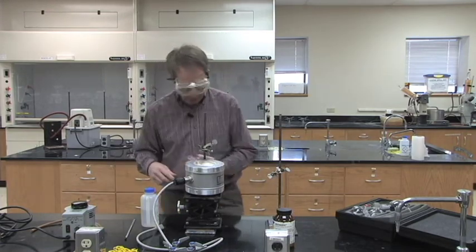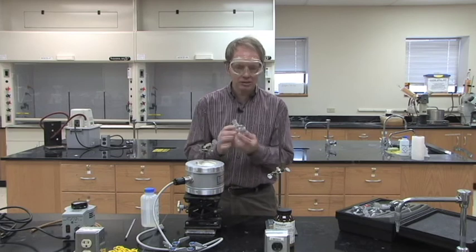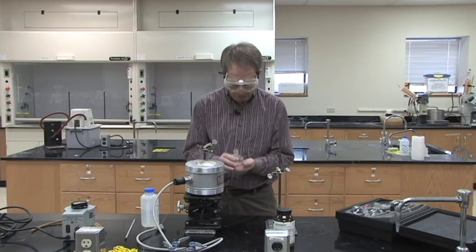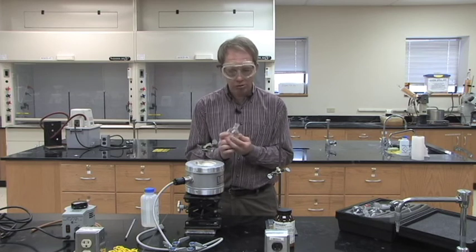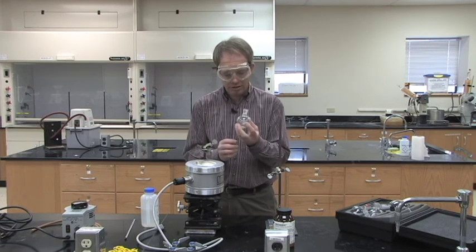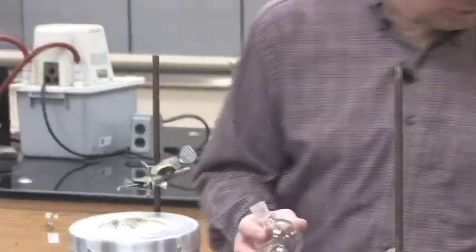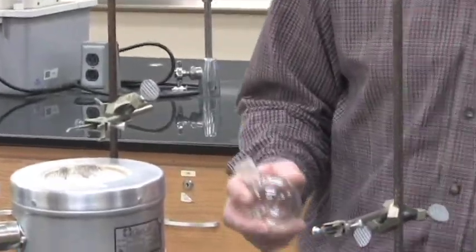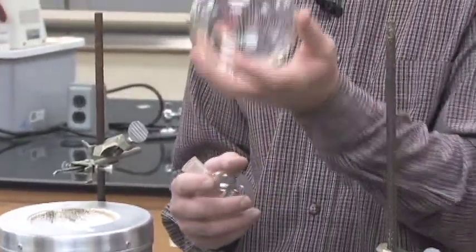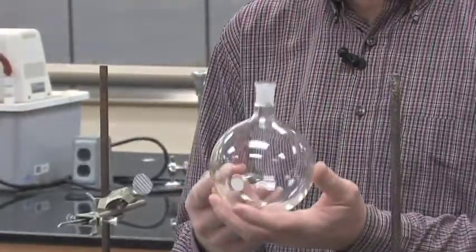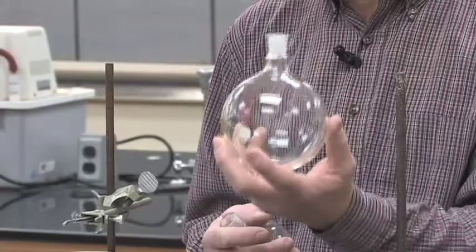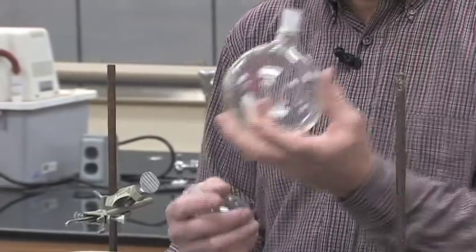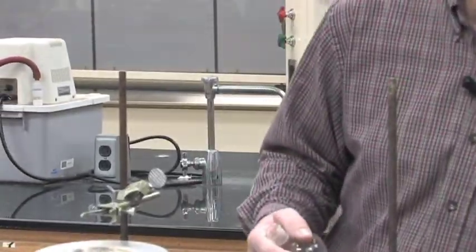In the boiling point experiment, the first thing you need to do is figure out what size glassware to use because it depends on how much sample you use. When you are boiling something or refluxing something, you want to make sure that whatever size you use is about half full. So here we have a 500 ml round bottom. We wouldn't want to put 25 milliliters of liquid in that because it wouldn't have enough liquid in it to heat up all the glassware to get a good distillation going.